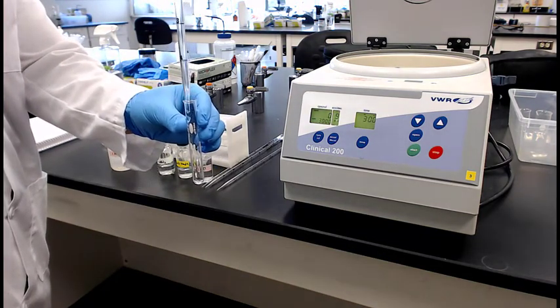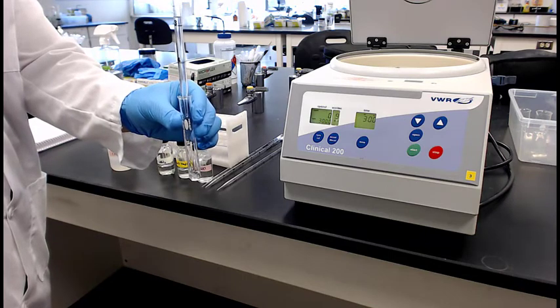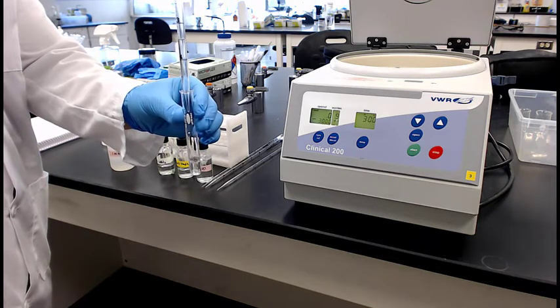So you saw the other solution, very clear, right? So here's the sodium carbonate. Puts that off in the test tube.